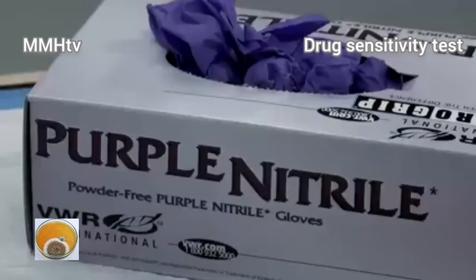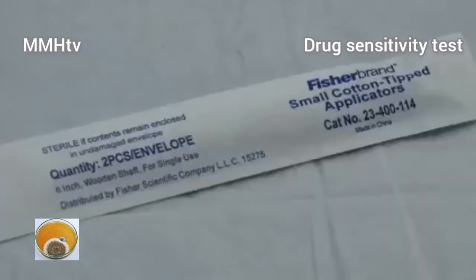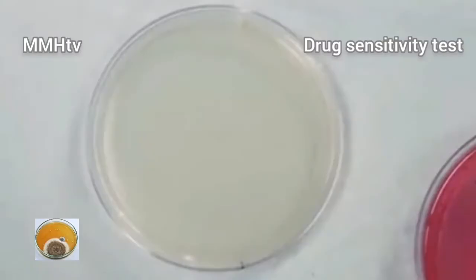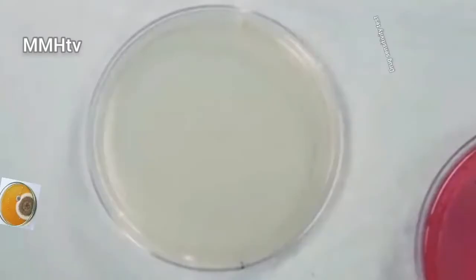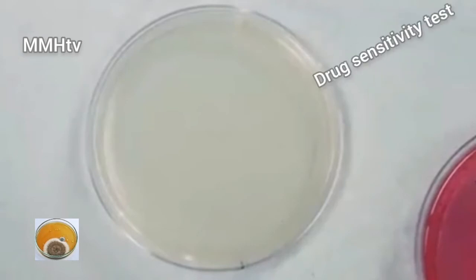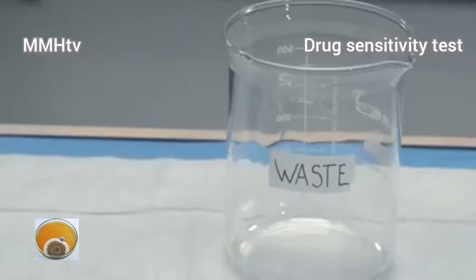You'll need gloves, tweezers, sterile cotton swabs, a marker pen, and a petri dish. This is a plate, a petri dish with a single colony of the bacteria that you want to test. You'll need a blank petri dish with agar media where you will grow the bacteria and do the test. You will also need a waste container.